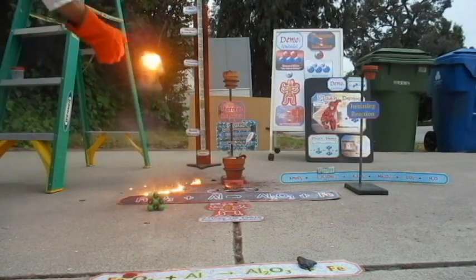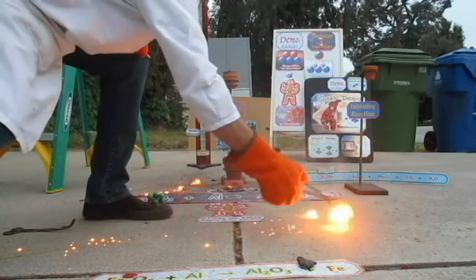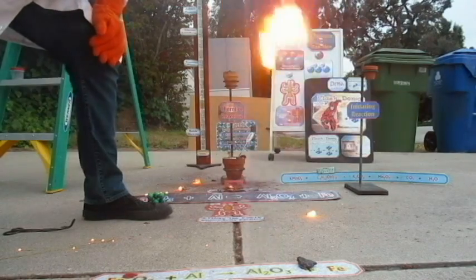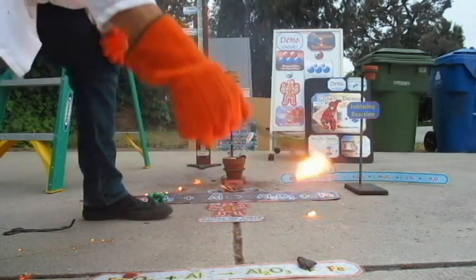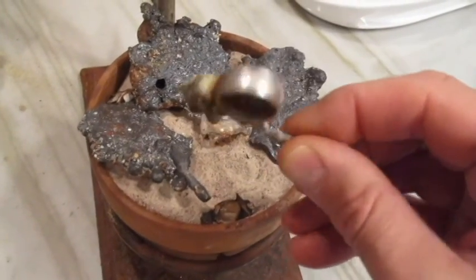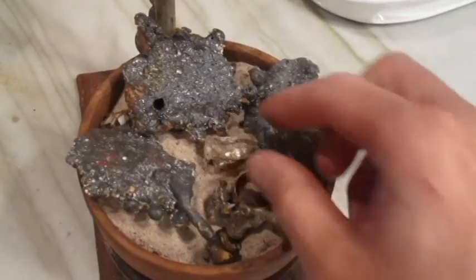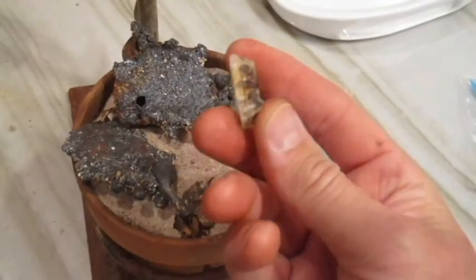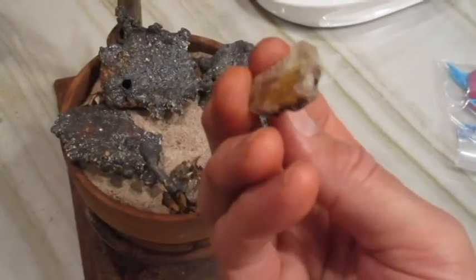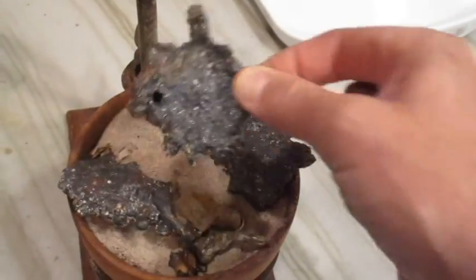Let's try to tap some out. Look at that. Molten. Is that cool? Hotter than any lava. You can see the products. You can see the ring. What happened to the ring? You can see the ionic compound, very melted right there. Look at that. And then this is all shiny, sparkly.